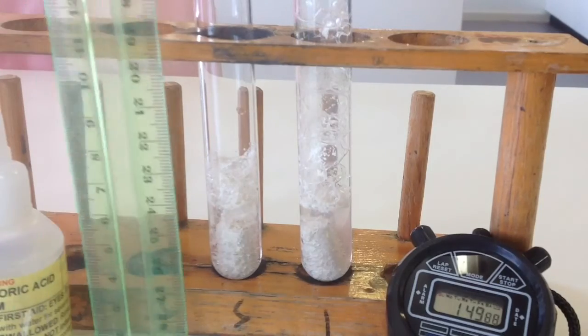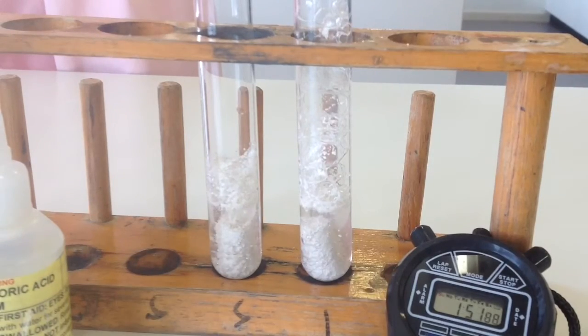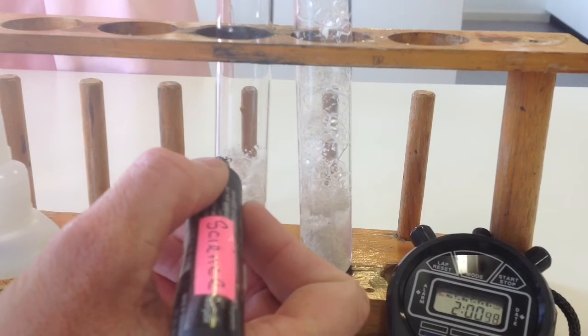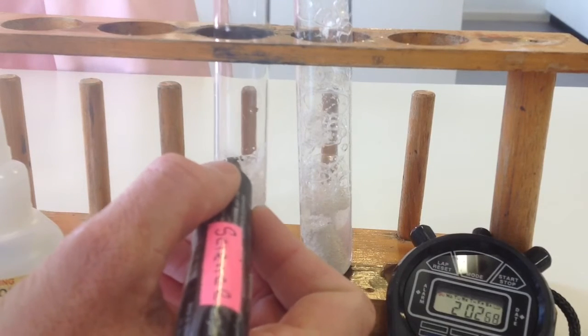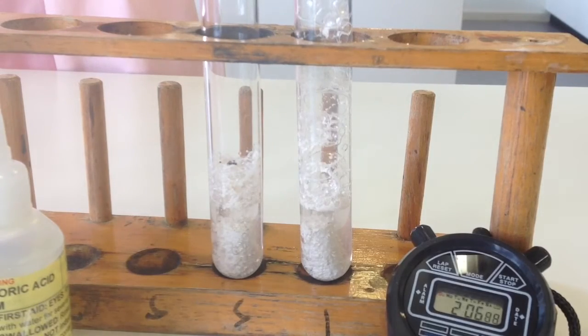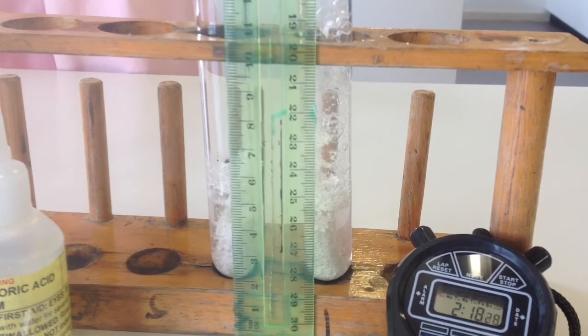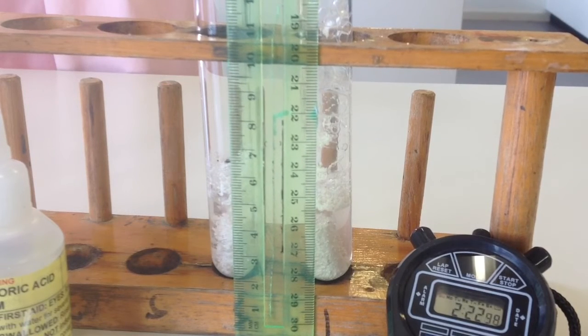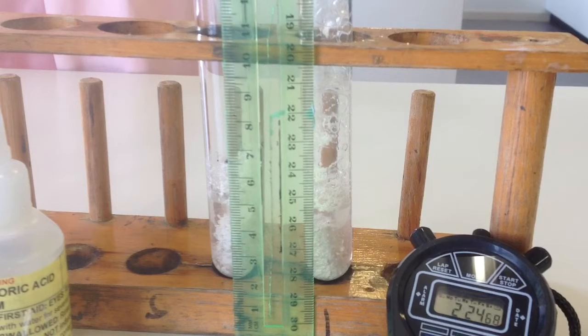Second one, there was a little bit of froth, so I'll put a mark where it got up to and you'll be able to measure that. Because this one stayed in the test tube. Here we go. There you go, it should be at, oh, look at that. 6 point what?